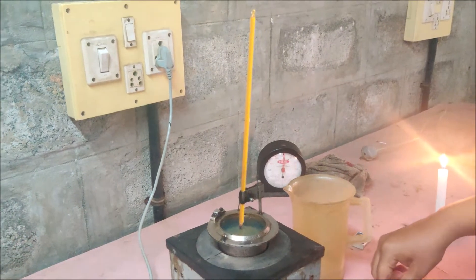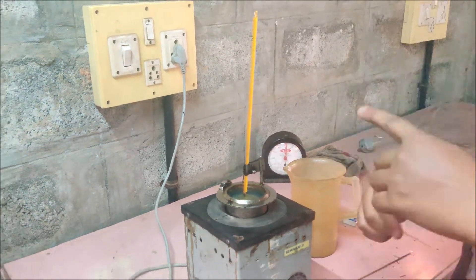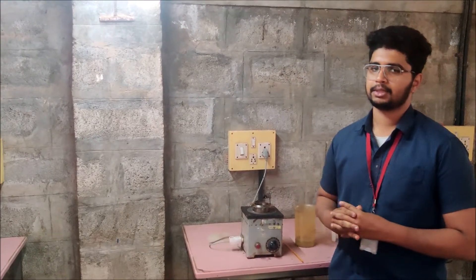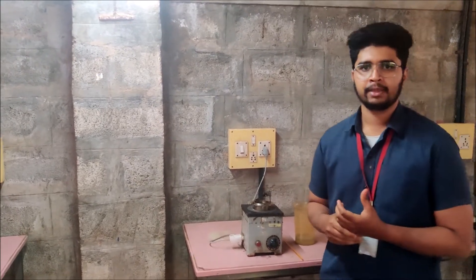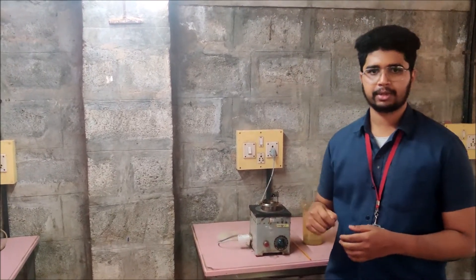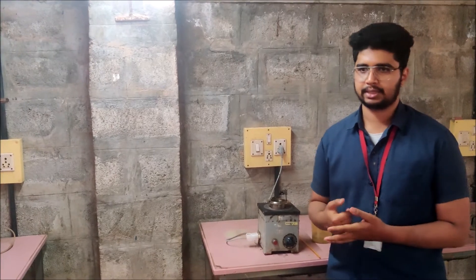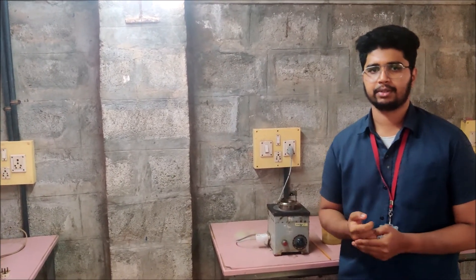That is how you note down the flash point and the fire point using Cleveland's apparatus. When you notice fire for just a fraction of a second, it's called the flash point. When the oil sample catches completely on fire, it's called the fire point. With the help of the thermometer, you note down both those temperatures — and that is how you determine flash point and fire point of any given oil sample. Stay tuned for future experiment videos.